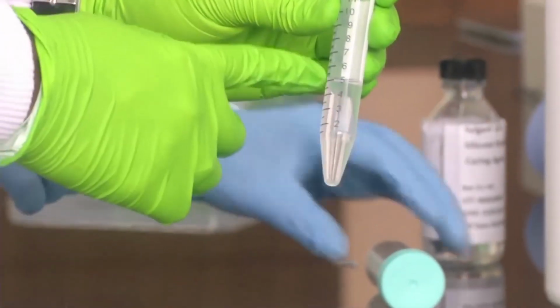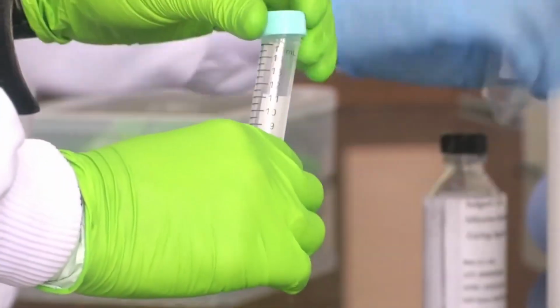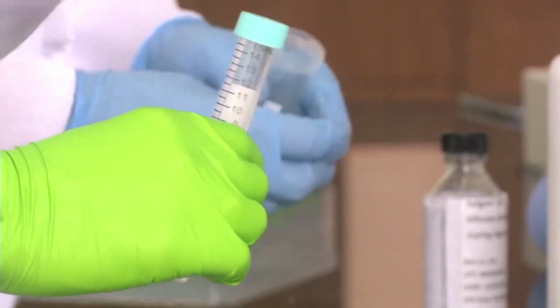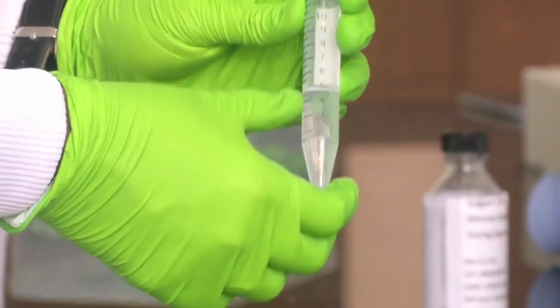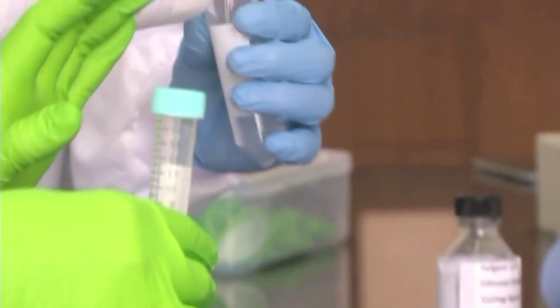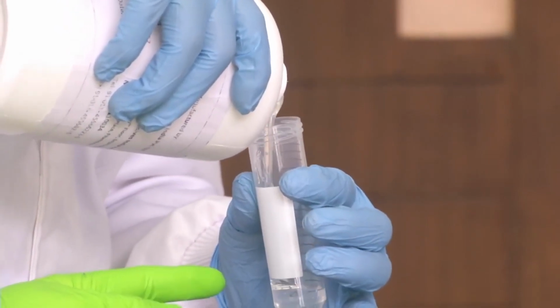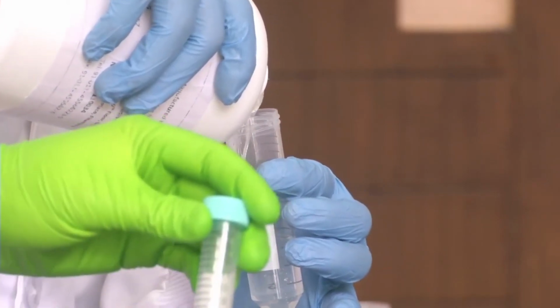So we have taken 5 ml of the curing agent in this tube. Now we have to mix this first in another tube. As I told, we will be mixing curing agent and PDMS in 1:10 ratio. That is 1 part of curing agent and 10 parts of PDMS. Because we have added 5 ml of curing agent, we have to add 50 ml of PDMS. So right now he is adding 50 ml of PDMS to the curing agent.